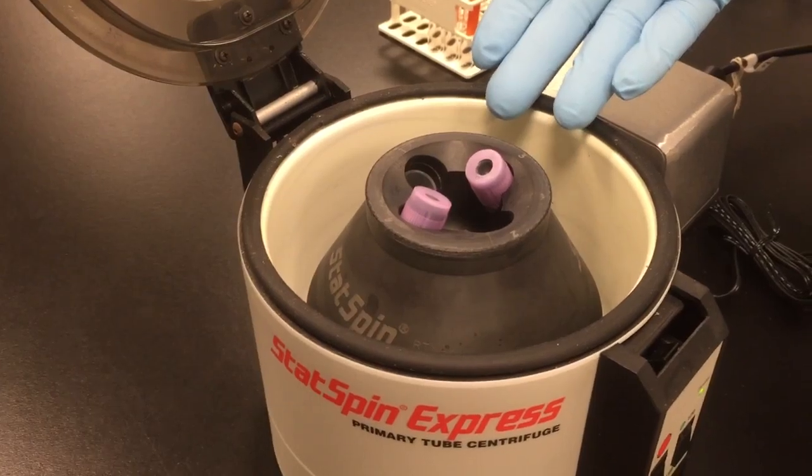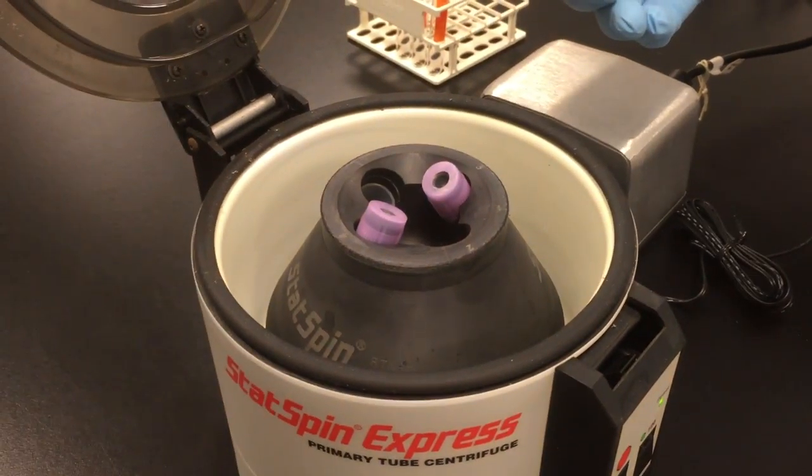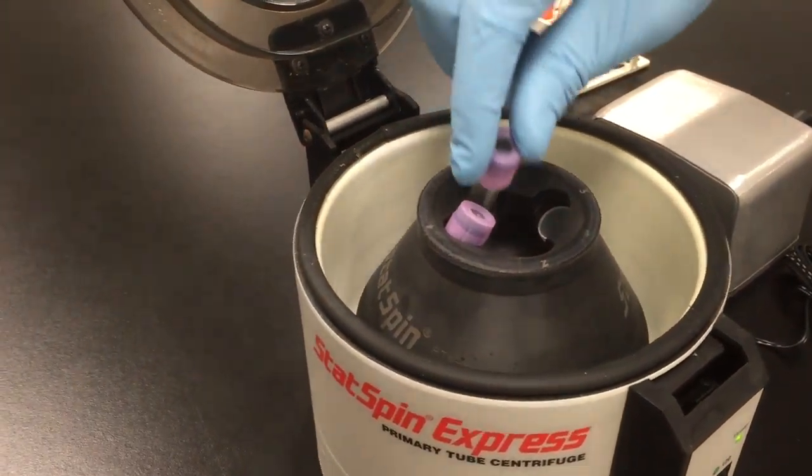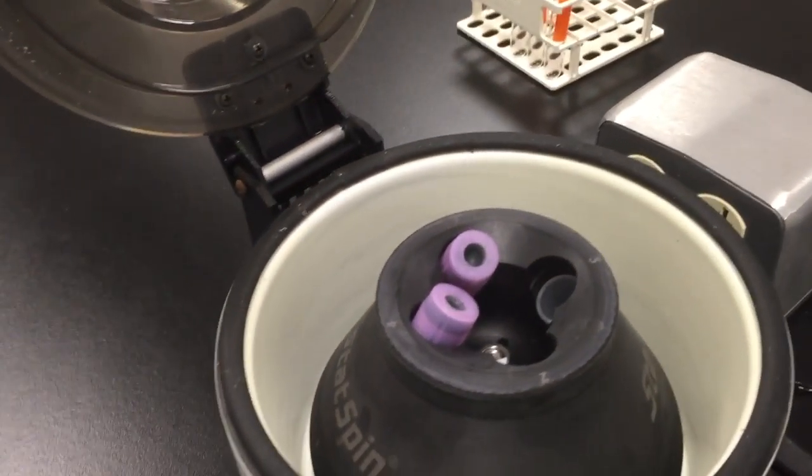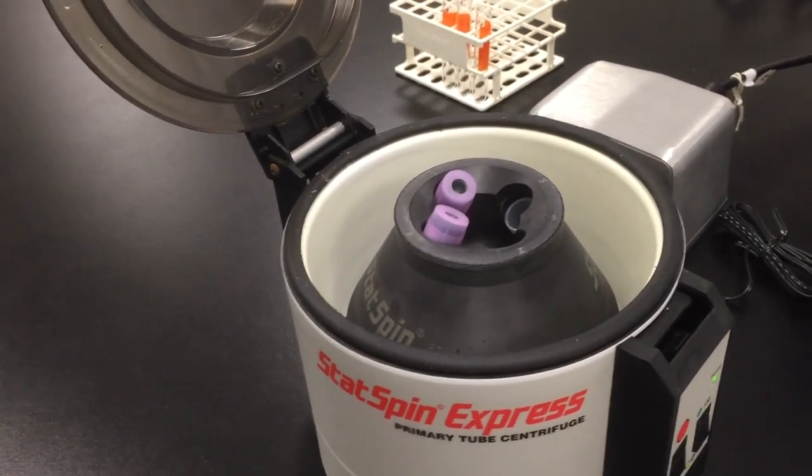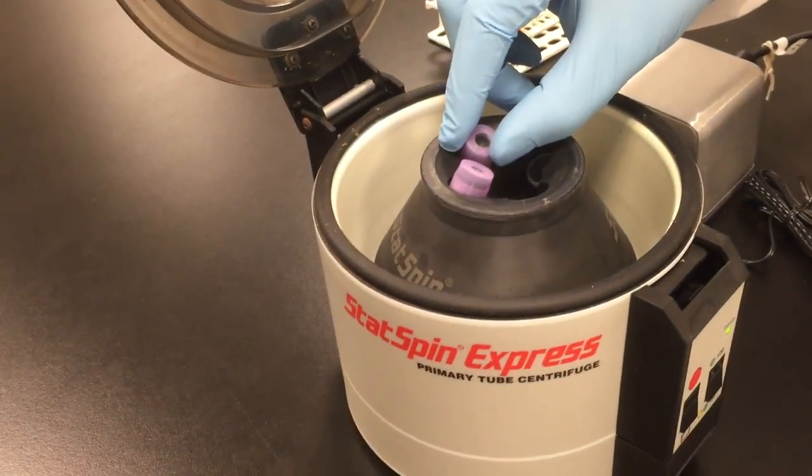If at any point in time you do put them beside each other or unbalanced, at that point, here's an example of it. At that point, when you turned on the centrifuge, it would begin to vibrate. It will shake.